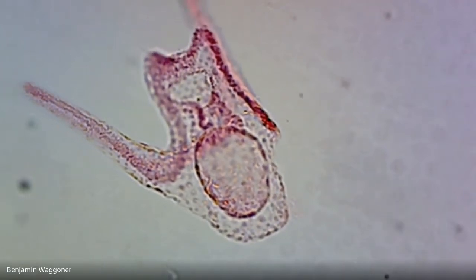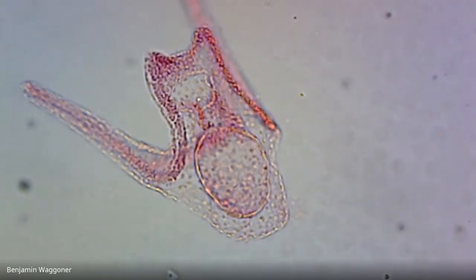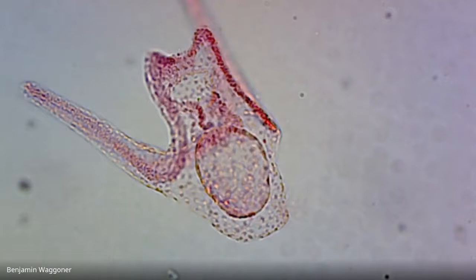This thing, if it were alive, would be perfectly able to swim. You can see they're darker than the rest. Those densely packed red dots, that's the ciliary bands. And you can see a pair of arms that would direct food towards the mouth. I'll try to find one more, and then we'll take a quick break.